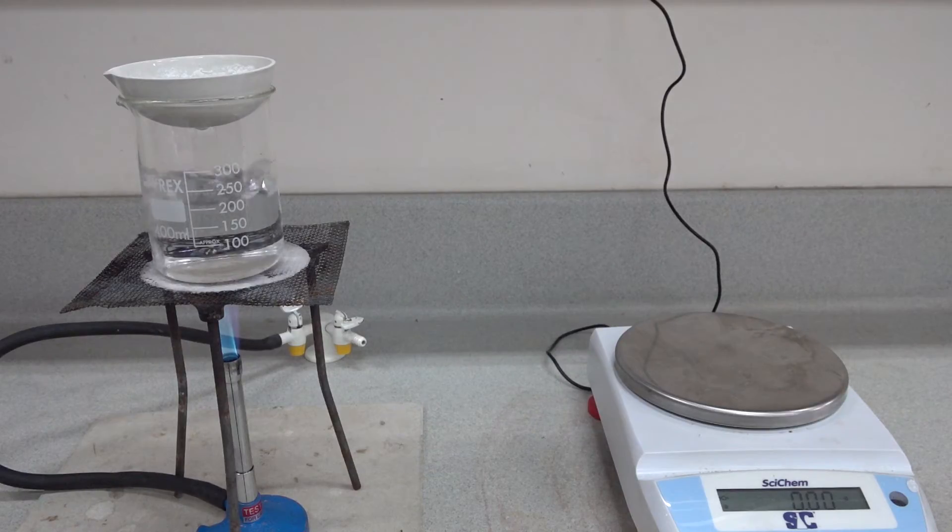Just waiting for the material to become really dry, remove all of the water before we take another mass reading on the balance.